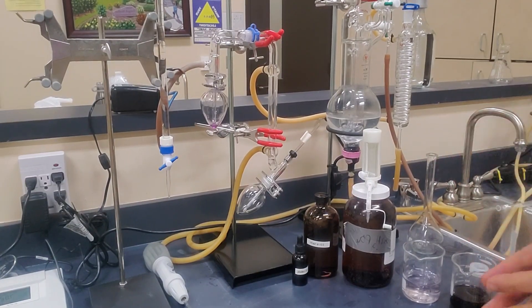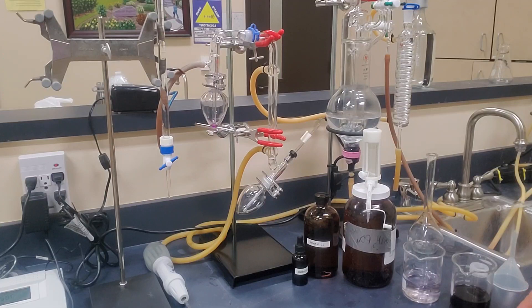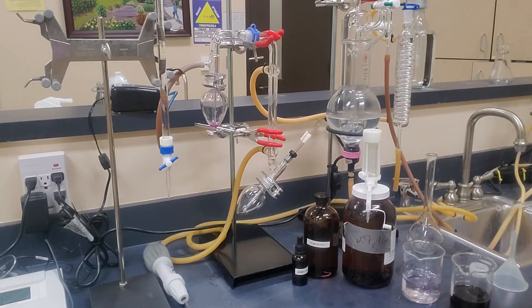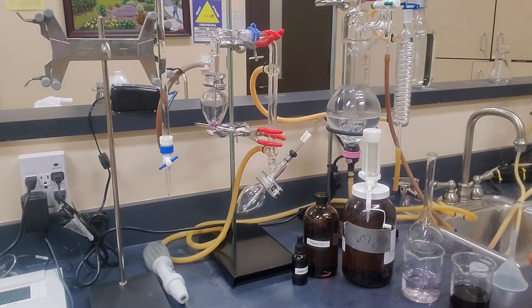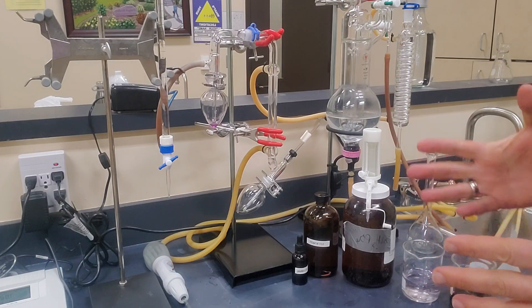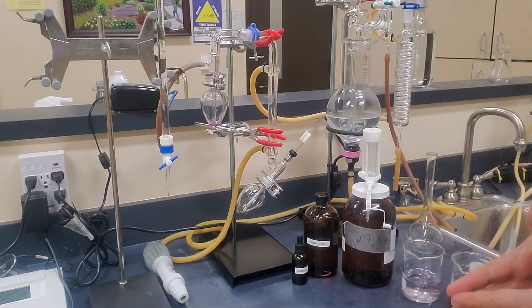Greetings everybody. I want to take you through how to do an aeration oxidation sulfur dioxide analysis. This is one of the more complex analyses that we do, so I'm going to take my time to make sure that you really get a good idea of all the things that you're going to need.